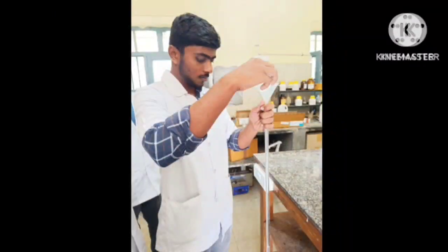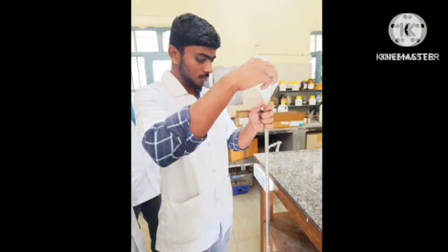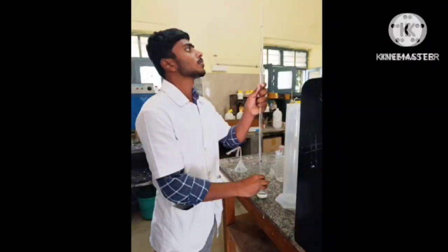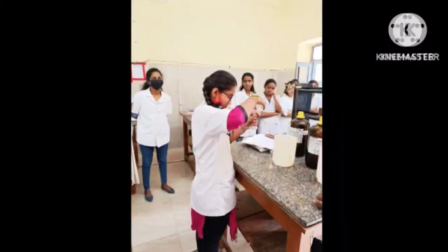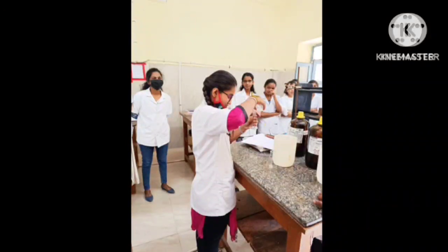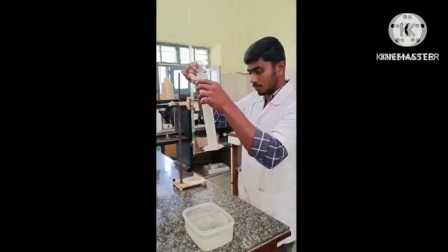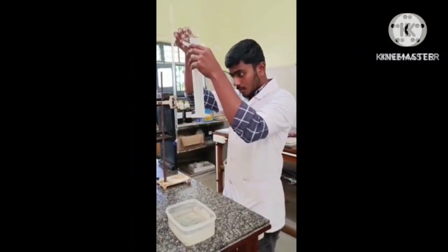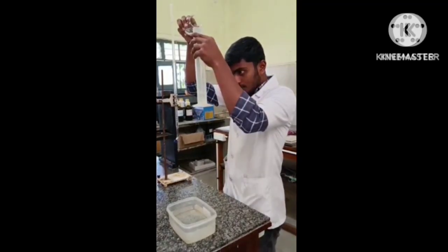Firstly, fill the burette with sodium thiosulfate using a funnel. After filling, note down the initial reading of the burette. Then take 10 ml of potassium iodide using a standard measuring cylinder and transfer it into a conical flask. Then take 50 ml of oxalic acid using a standard measuring cylinder and transfer it into a reagent bottle.